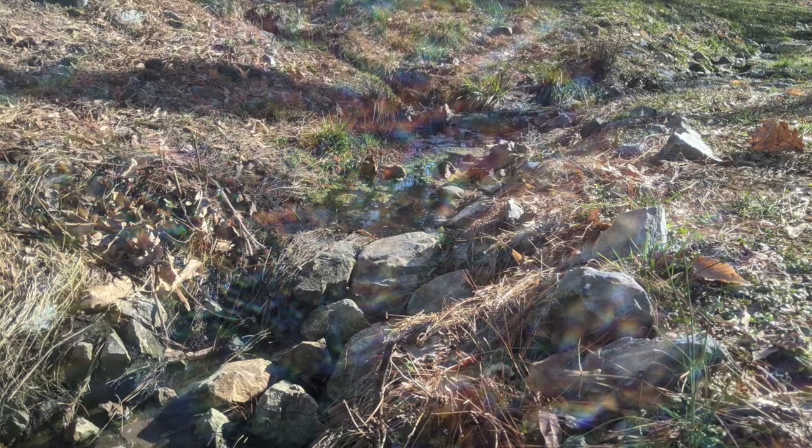All right, so the first thing that we're going to do, whether you're collecting water samples with me or doing this at a stream near your house, is go out and do a visual survey of the area and estimate the density of trash that you see. You're going to determine if the area has heavy trash, moderate trash, light trash, sparse trash, or it's clean. I would say that clean is like you can't find any trash at all.